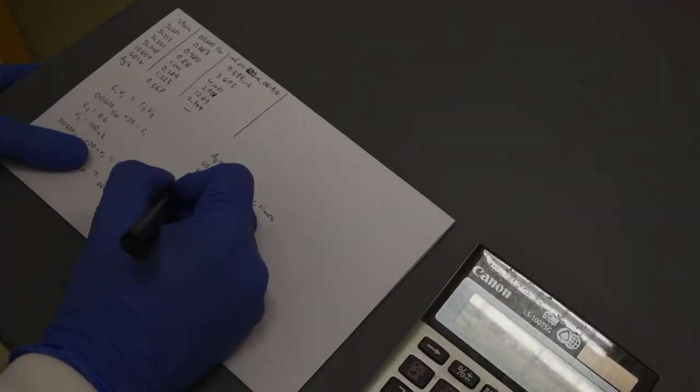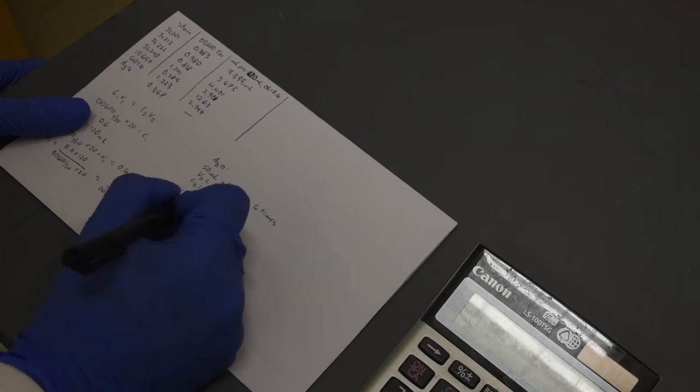The Agrobacterium is generally used at a higher OD, 2.0 or 6.0 depending upon how much you have. Generally, higher is better.